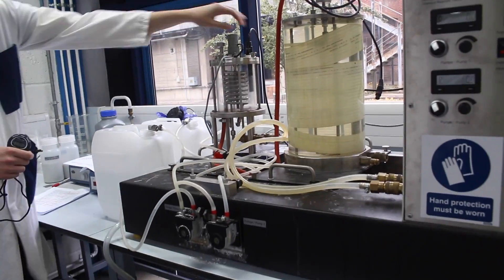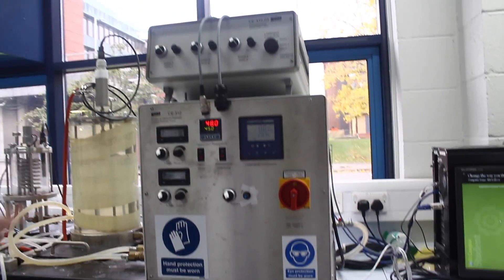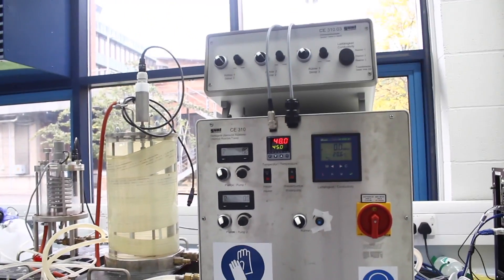We also need 800 millilitres of 2.3% sodium hydroxide — 400 millilitres for the CSTR reactor and 400 millilitres for the plug flow reactor. Similarly, 800 millilitres of 5% ethyl acetate is needed, again halved between the two parts of the experiment, along with glass beakers to hold the solutions. The two chemicals would mix and flow into the reactor; we monitor the reaction by inserting a probe to take readings. The two knobs control the flow rate of the chemical pumps at 40% and 80%, and the master switch turns the system on or off.